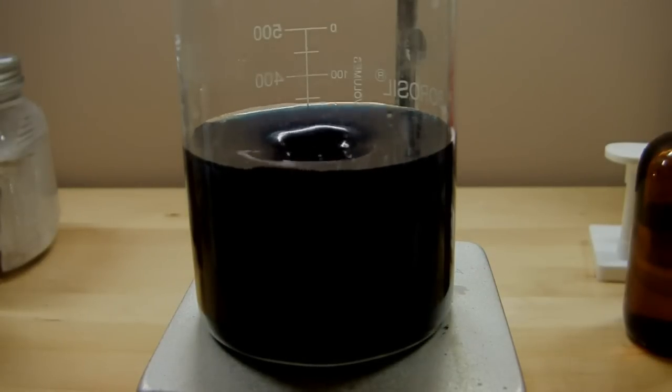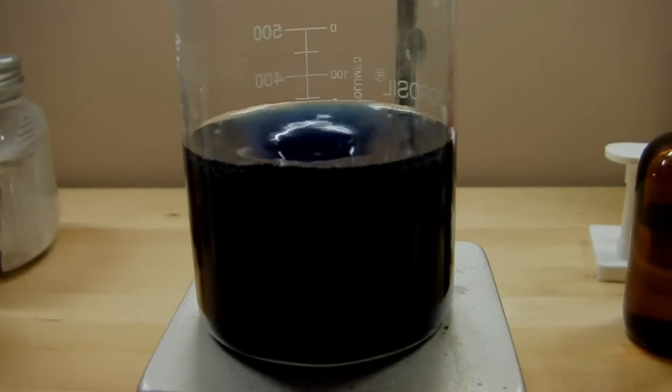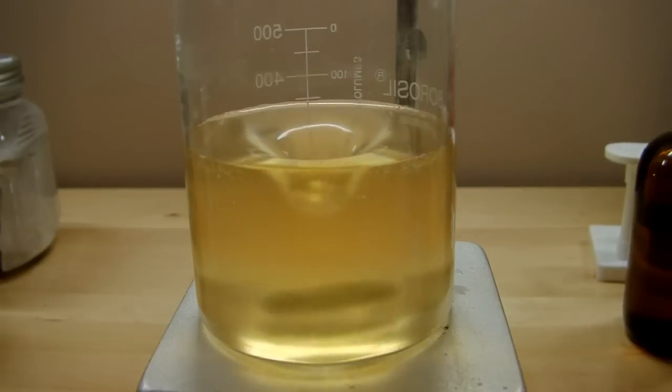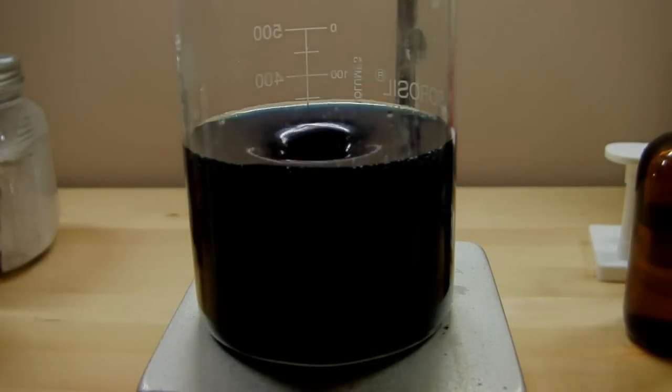Now that color change is pretty amazing isn't it? So what exactly is happening here? Well first off you saw that there's an amber color to it when it started and then that immediately changes to this blue. And now if you'll watch it'll repeat so the blue clears. The amber deepens again and once it gets to a certain point the color change is instantaneous or nearly instantaneous.